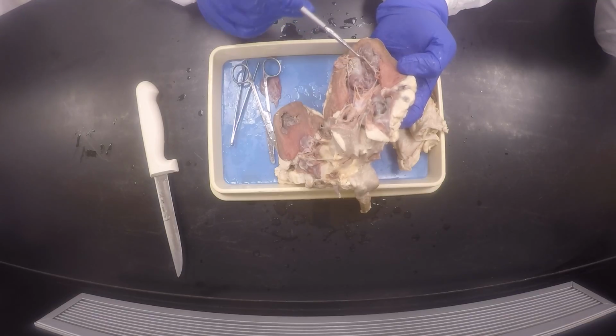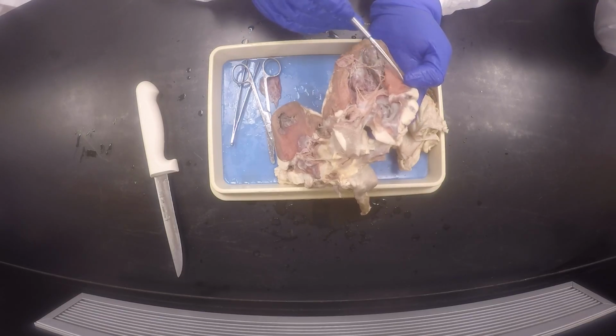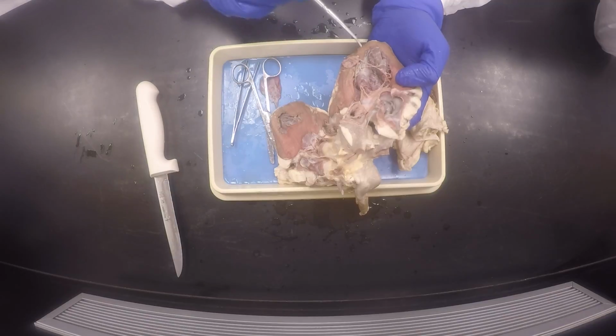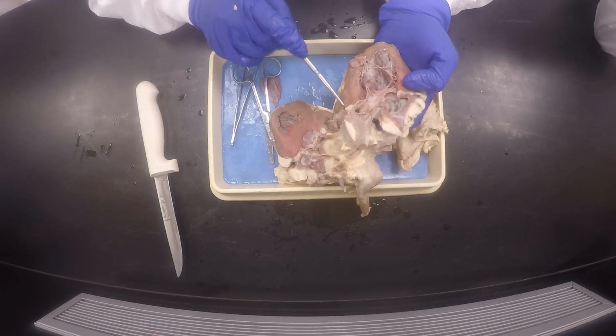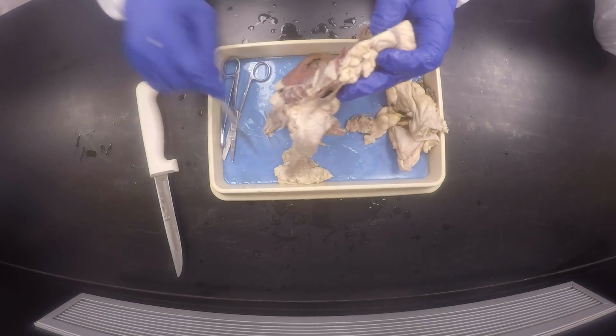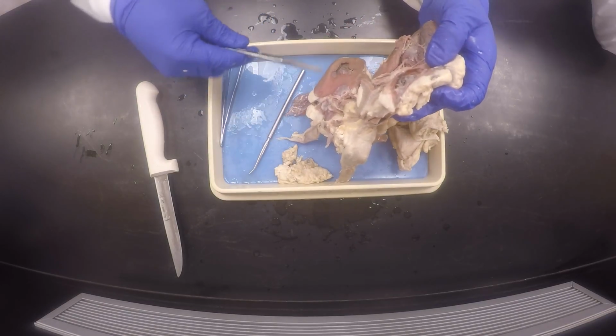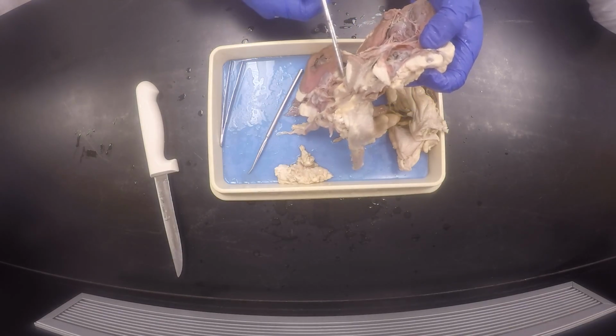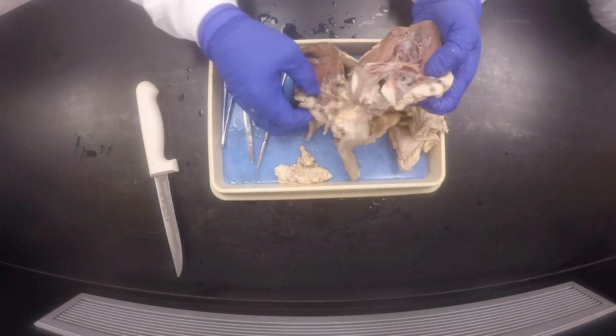They are much bigger. And this here would be the bicuspid going into the left side. You see, this is the left side. My right side would have been here, and my right side is on this side. I'm sorry about that, because my heart just didn't work out for me.